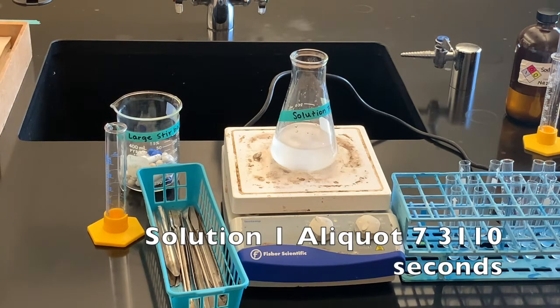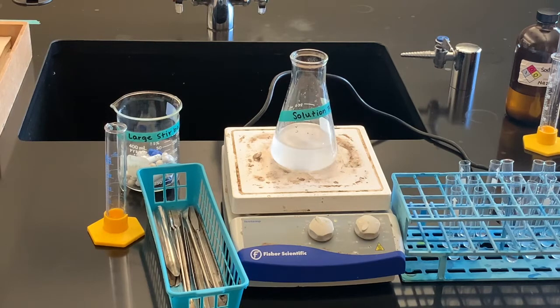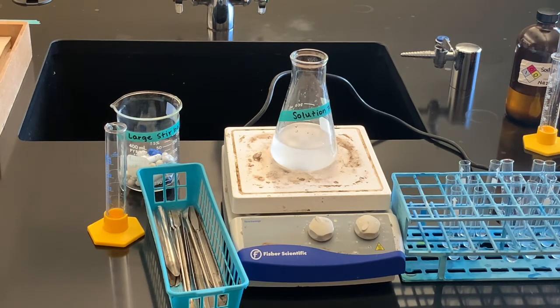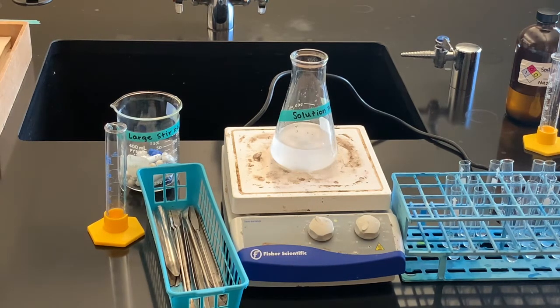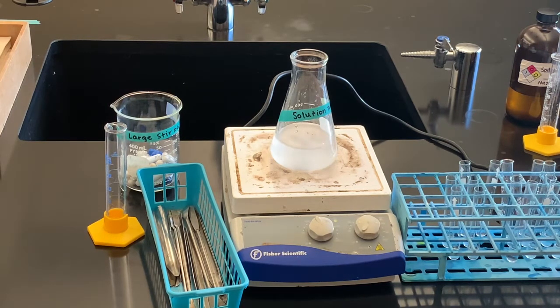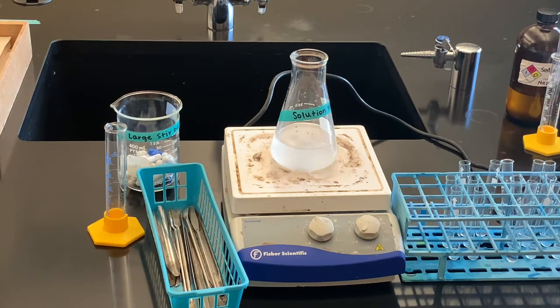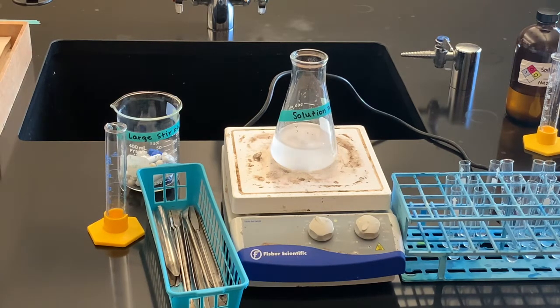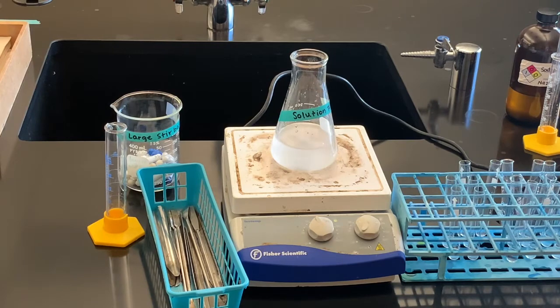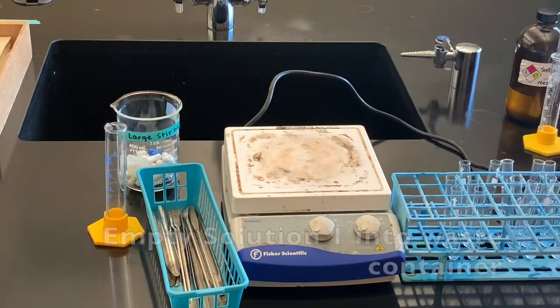Now that we've added our seven aliquots and have the times for each of those color changes, we're going to continue on to solution two. It's the same process — when I add the beaker to this flask, I will start my time, and then each time I see that color change I'll add one more of these test tubes. So we're done with solution one.